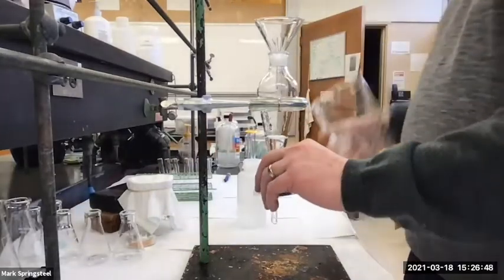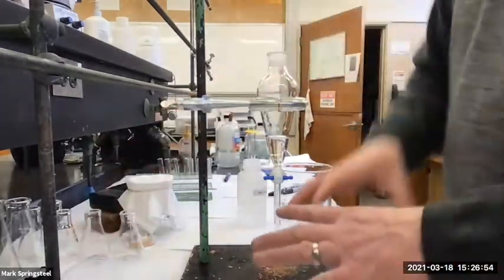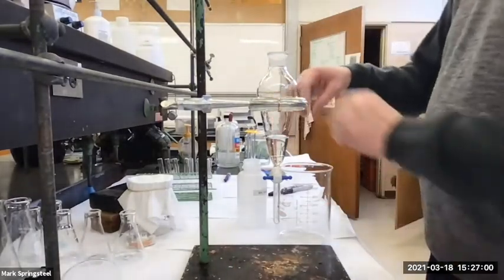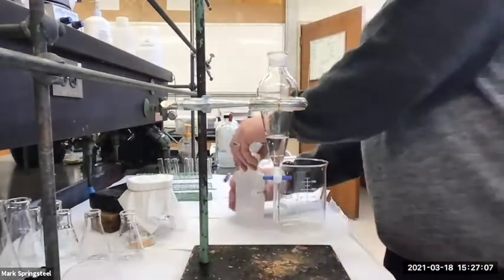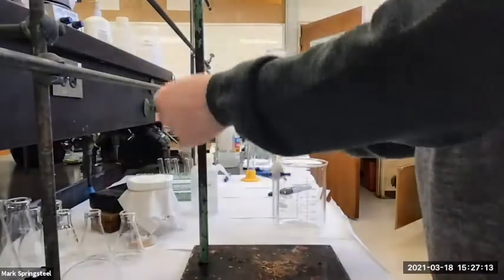When that happens though, chemists don't give up usually. They're like, oh no, we gotta get this going. So what they do is a lot of times you'll take paper towel and soak up all the solution, and then put it in a beaker and add an organic solvent to extract it out of the paper towel and then put it back. But if your counter wasn't clean, now you have more impurities. But you still will do it if you spent, say, a month trying to make a particular molecule. You don't want to just give up on the counter.